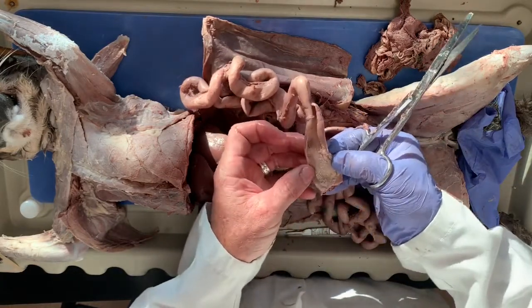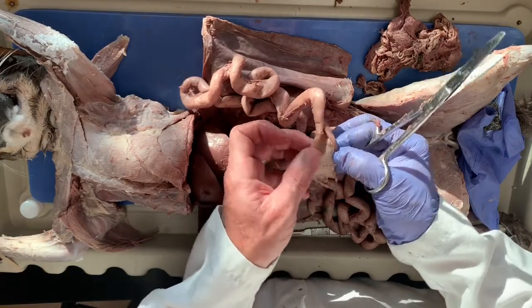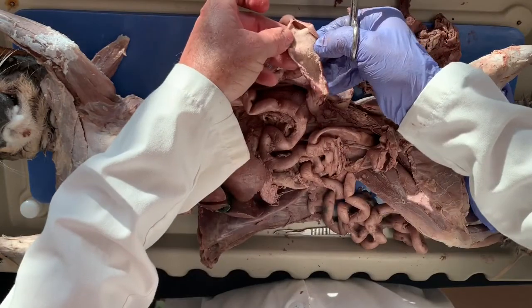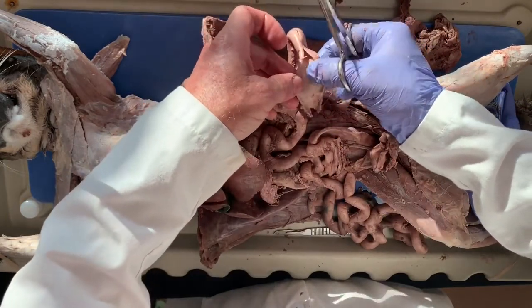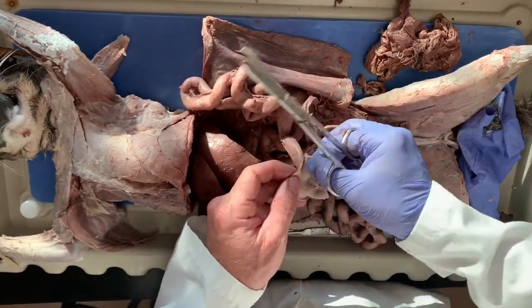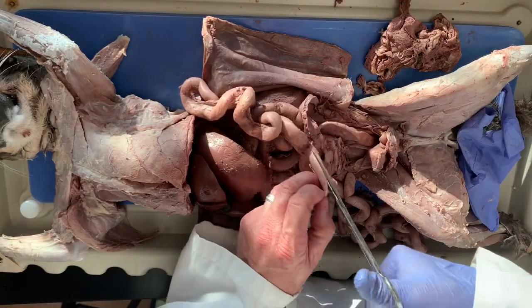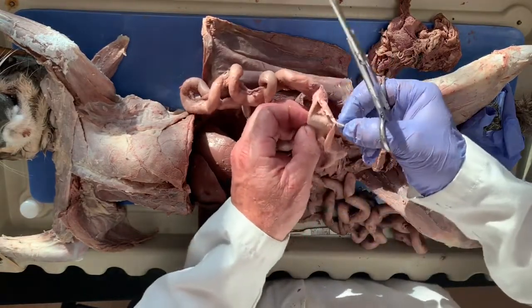Okay, so all of this, it looks like hair and stuff. That's all the villi and microvilli. Okay, all these tiny little extensions increase the surface area so we can maximize absorption. I'm not seeing any more, oh, maybe here's some right here. Yeah, there's some more right there. Look at that. That's a tapeworm.